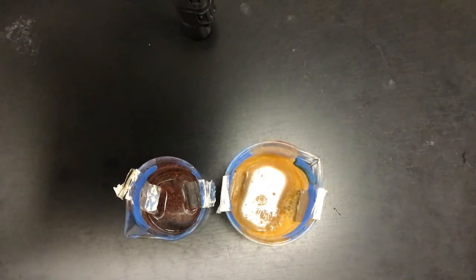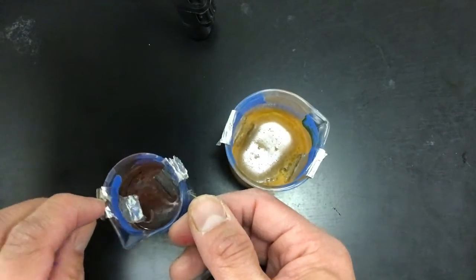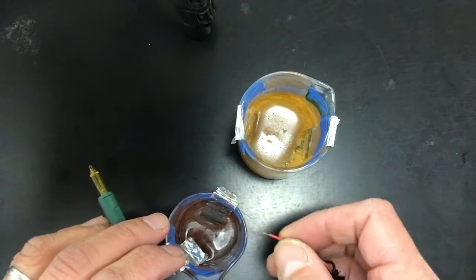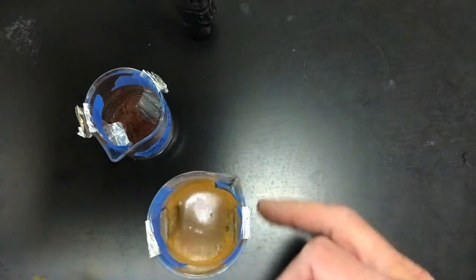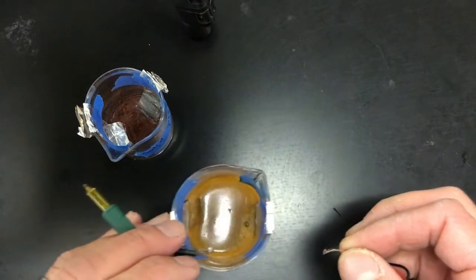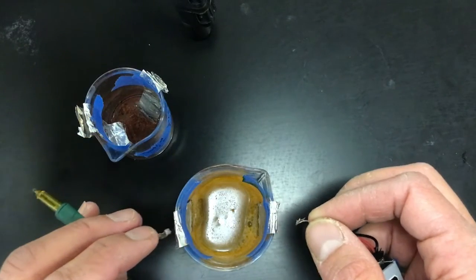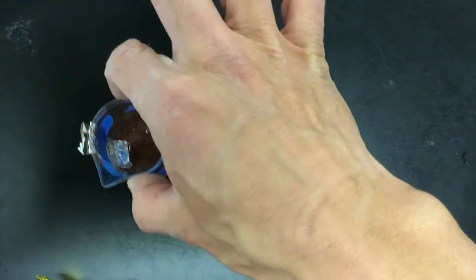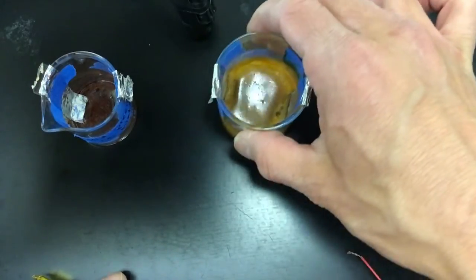We can also test the conductivity of this in water. The first one, you can see in water. I have the light here. Here we go. Nothing happens. Whereas this one here, let's try this out. And that conducts. So the stuff in the filter paper definitely conducts. The stuff in the cup did not dissolve or conduct when it was in water.